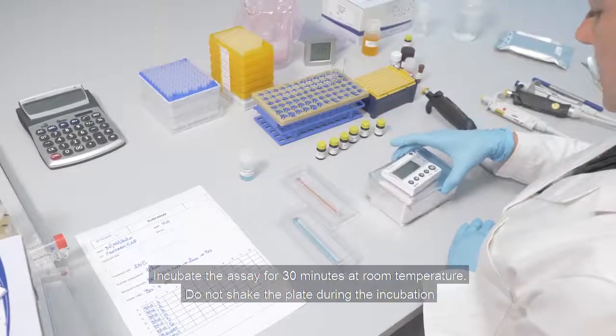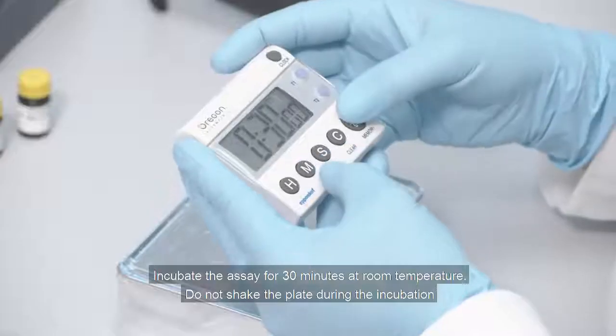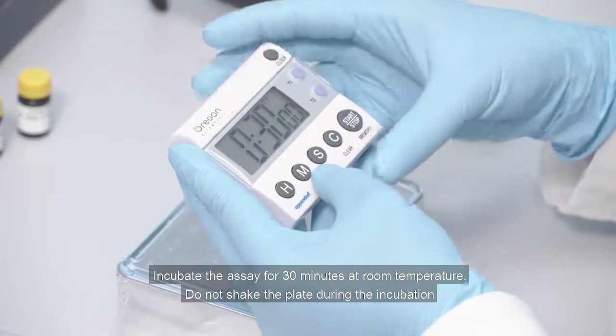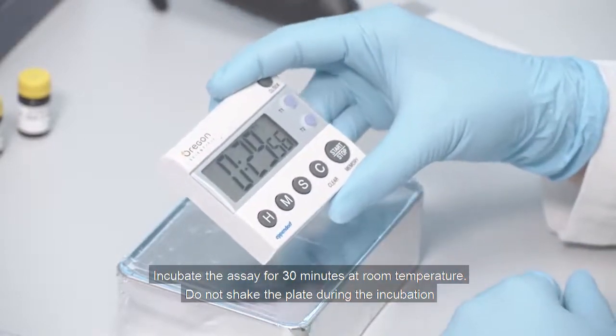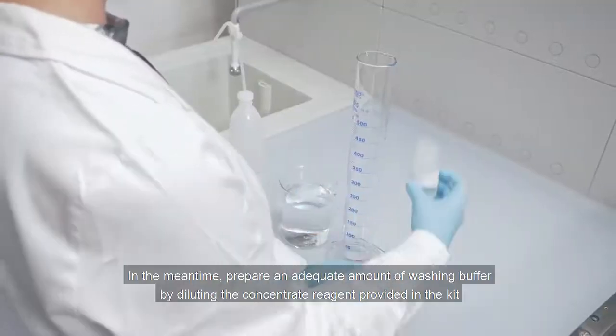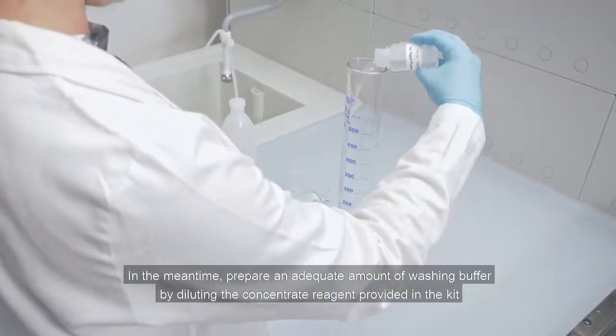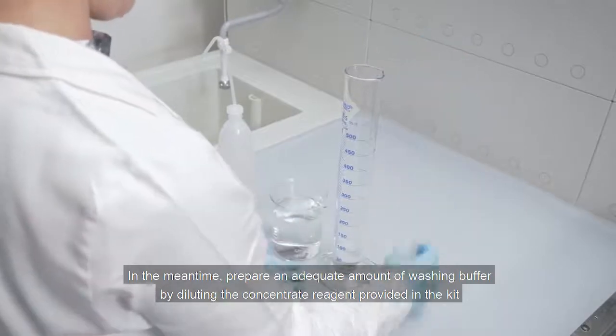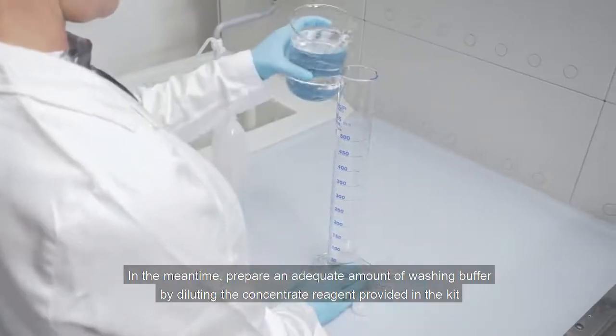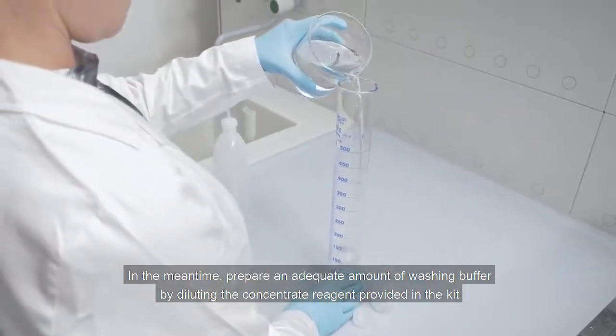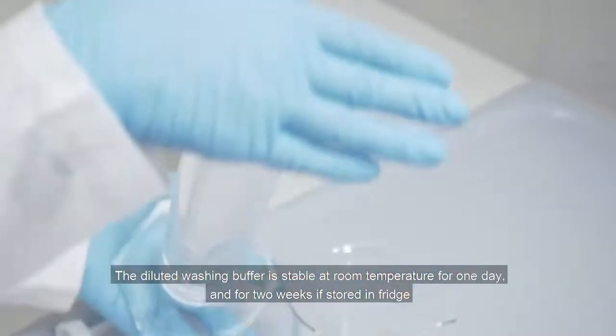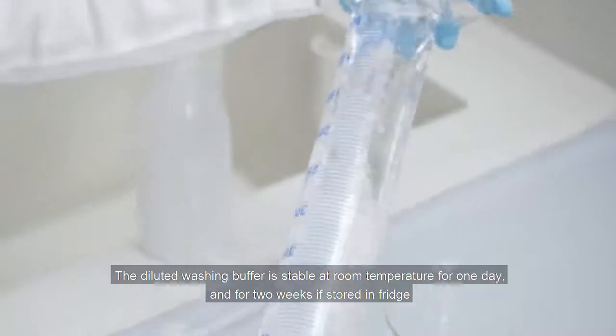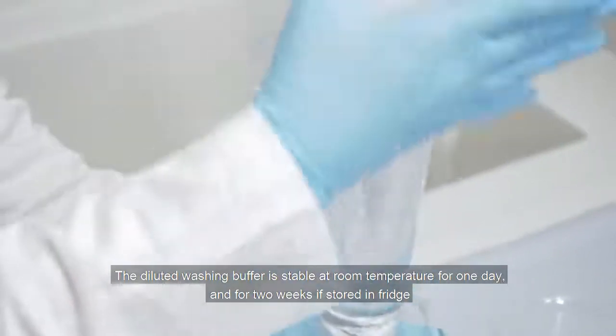Incubate the assay for 30 minutes at room temperature. Do not shake the plate during incubation. In the meantime, prepare an adequate amount of washing buffer by diluting the concentrate reagent provided in the kit. For routine analysis, you can prepare in bulk. The diluted washing buffer is stable at room temperature for one day and for two weeks if stored in the fridge.